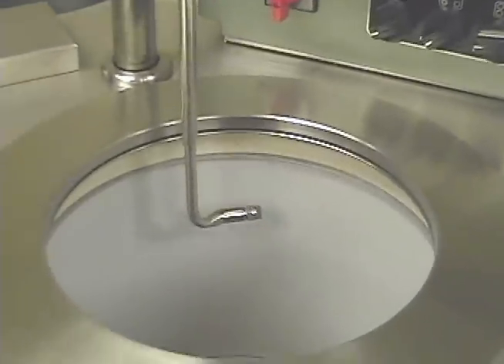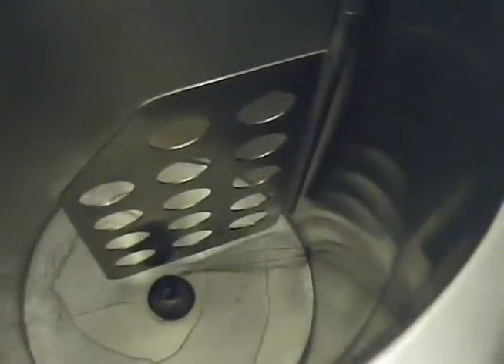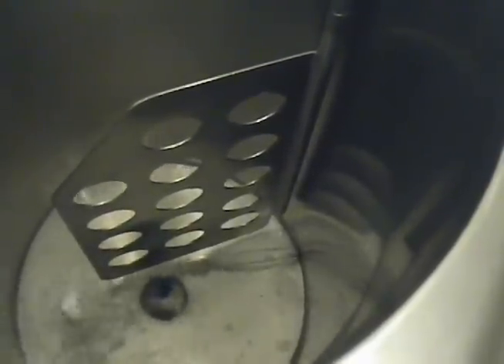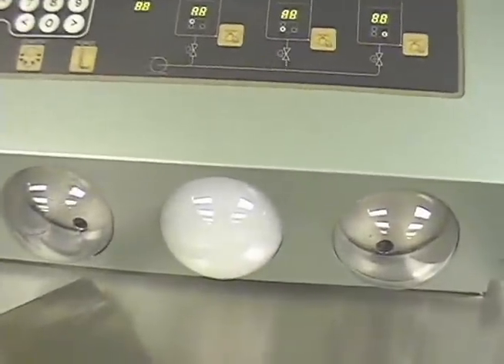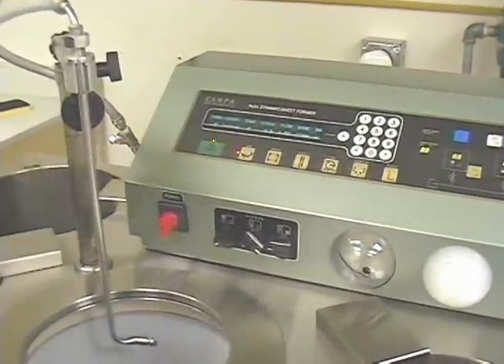To make a sheet on the ADSF, if you are making a single layer sheet, introduce water into one of the three onboard tanks. To produce multi-layered sheets, you will have to fill the other tanks as well. The machine will make each layer in sequence automatically. Add pulp to the water to obtain the desired consistency, usually between 0.1 and 1%. Agitate the furnish with the mixer and recirculate it through the mixing chamber.